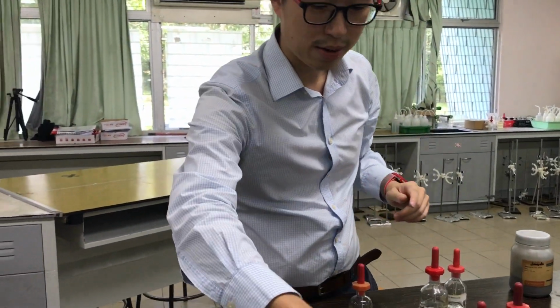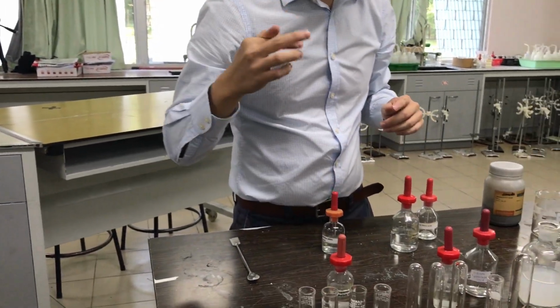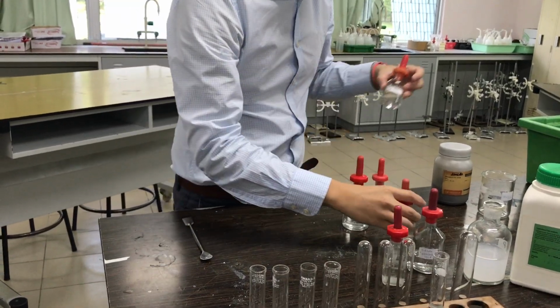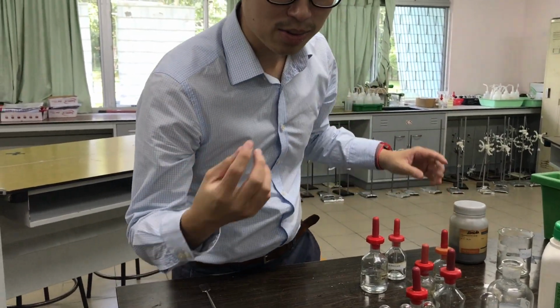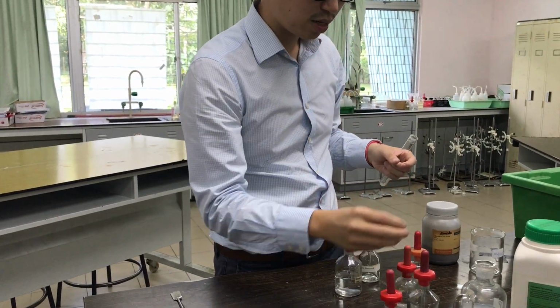Test for gas, am I correct? What's the first gas? Okay, remember the smell of ammonia? Yes. What does it smell like? You call it pungent, okay?